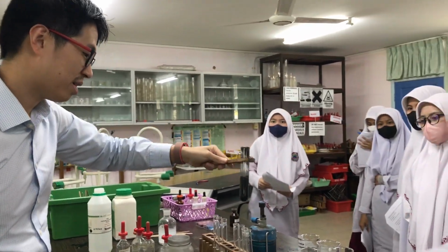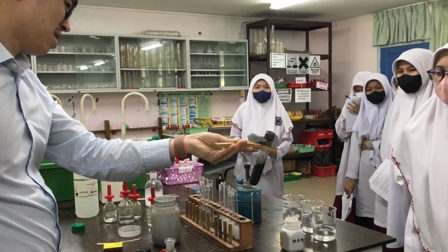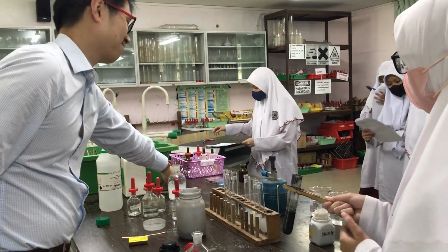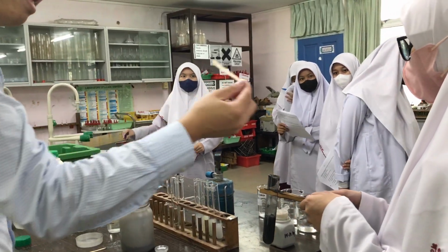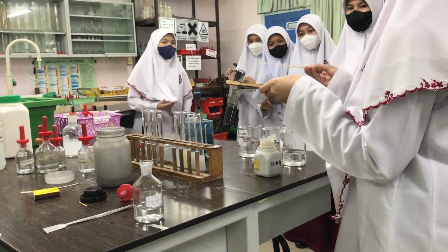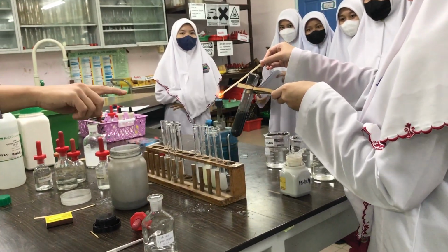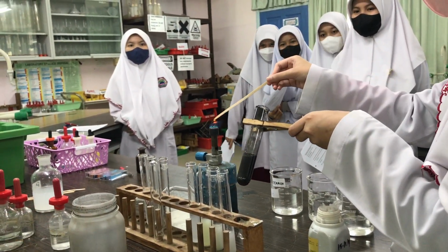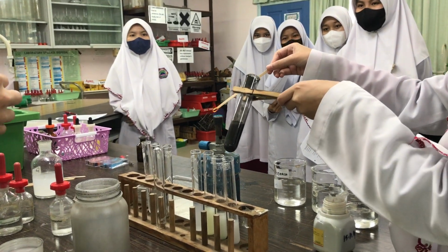Okay, alright, come. So the oxygen gas is continuously being produced. How do you test for oxygen gas? Glowing or burning splint? I don't know. You try that. Okay, come and see what she's doing. So she's producing oxygen gas. No, it's not coming. Okay.